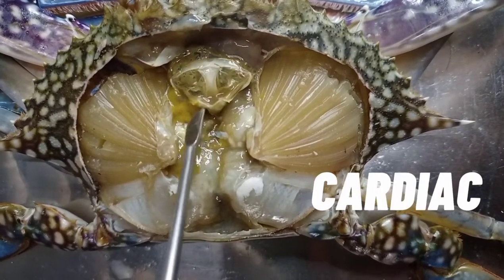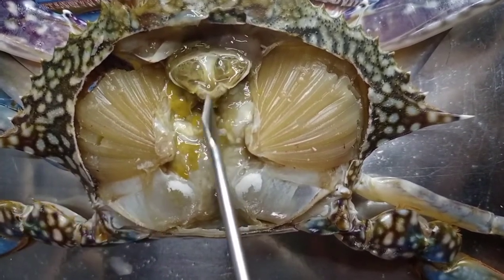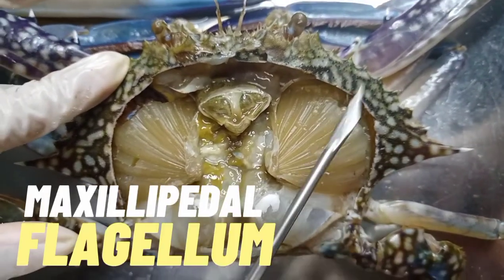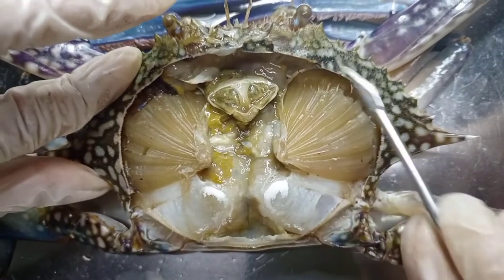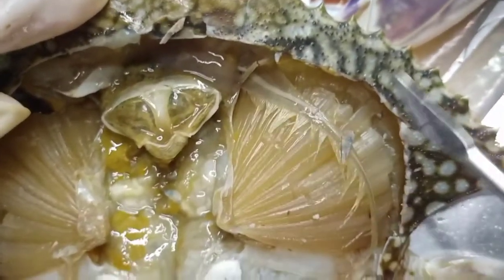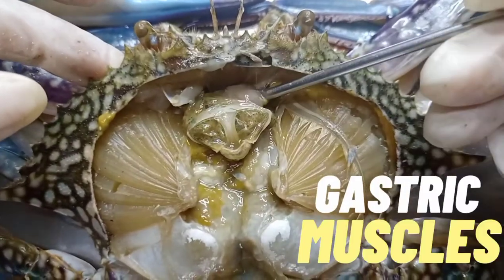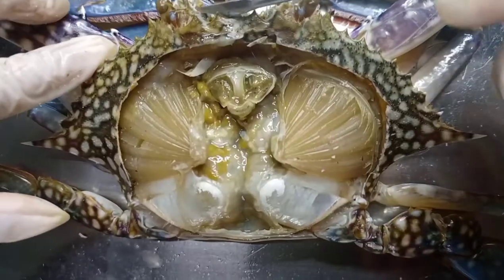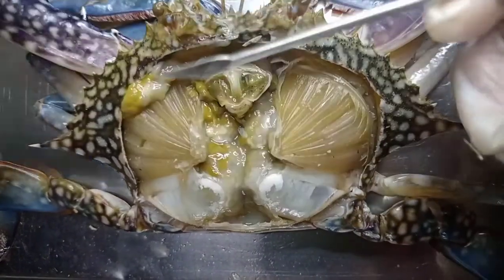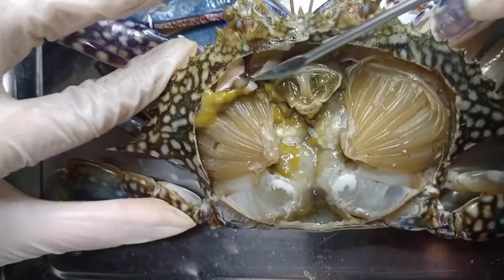This right here is the cardiac stomach. And here is the brain of the crab. Below here is the maxilliped flagellum. This structure here, as you can see, is the gastric muscles. Now let's get the hepatopancreas — this is the hepatopancreas of the crab.